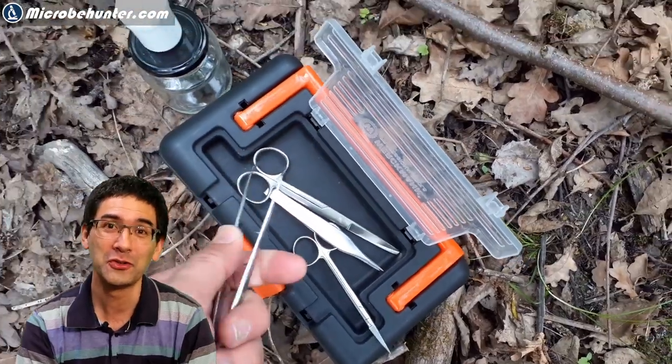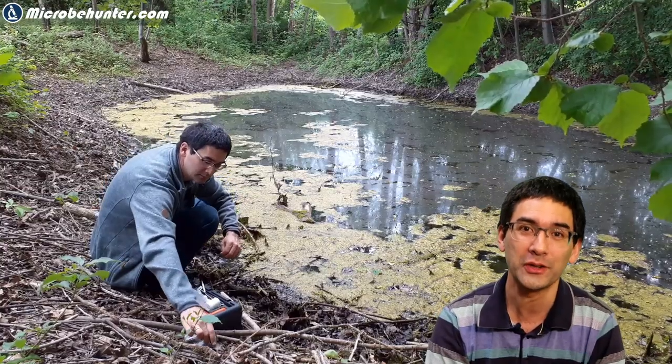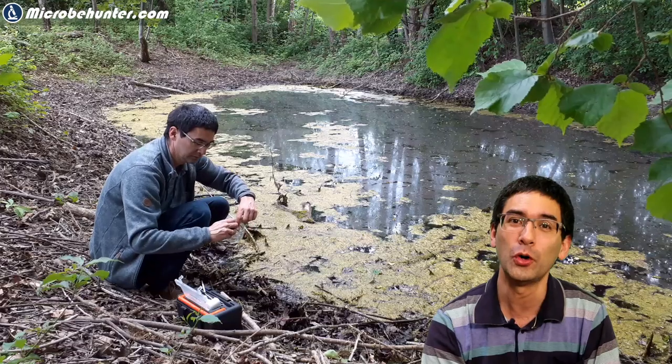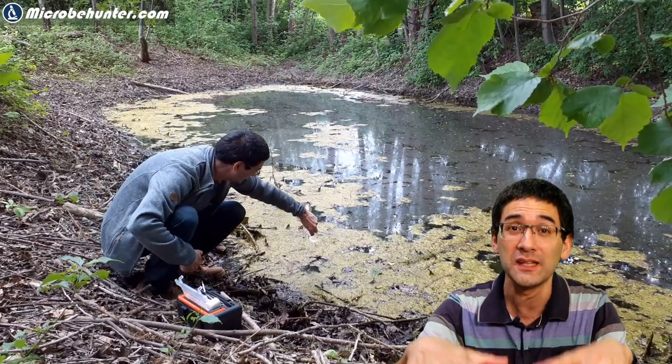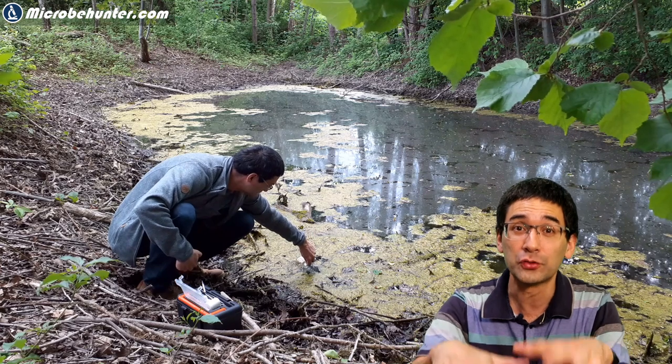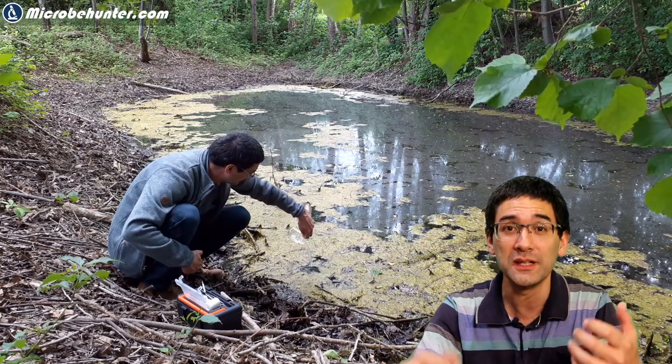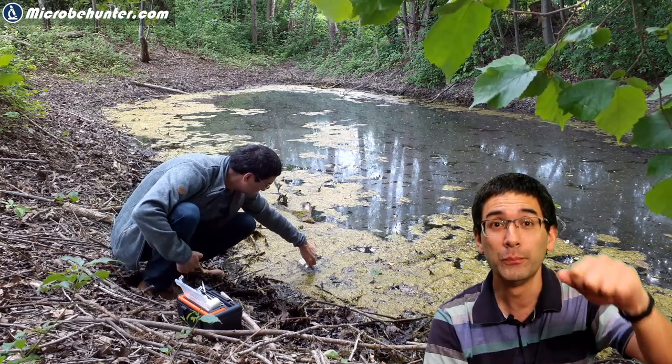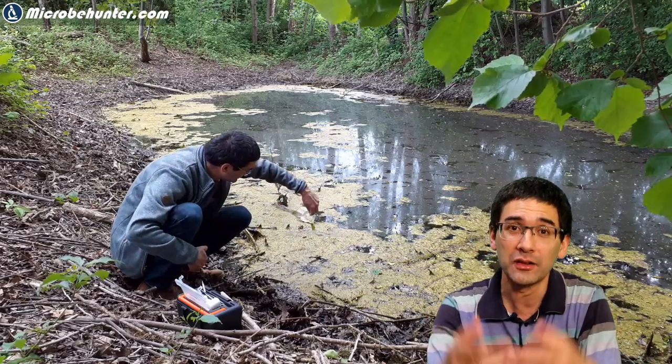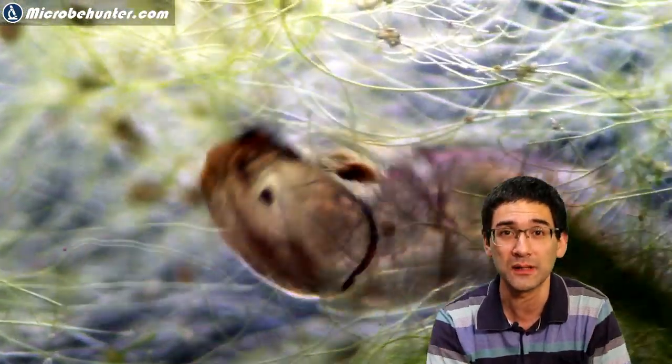I started to collect some of the pond water. One important thing is to always agitate the ground a little bit, because many living things settle down in the sediments. I took out a little water and put it back in to agitate the ground, so you can get more organisms this way.